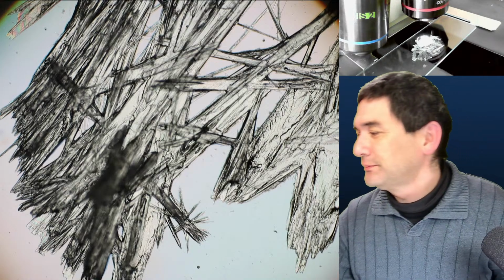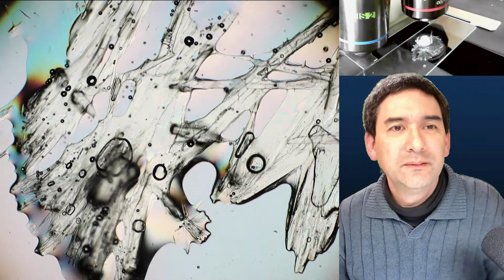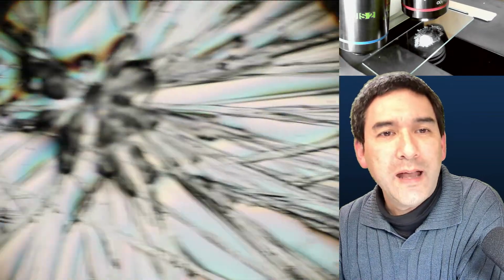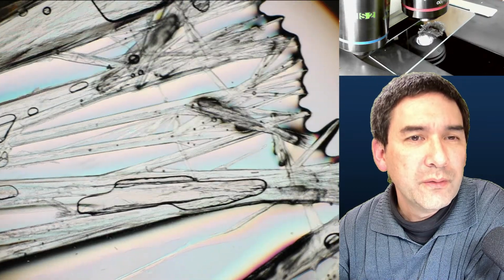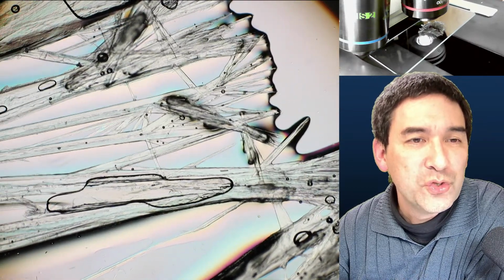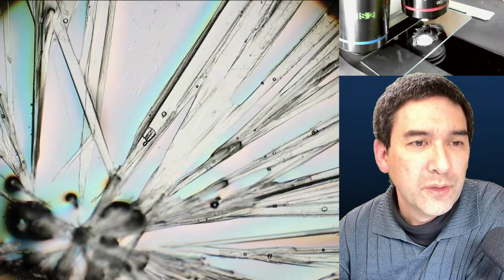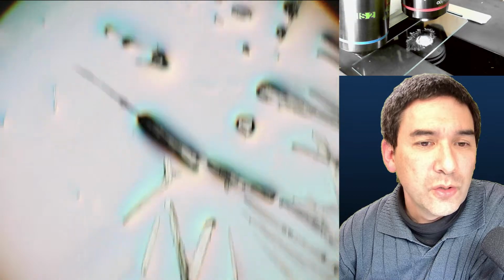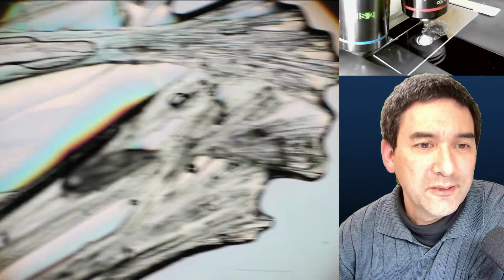And here again, let's add a little bit of water to see how this actually works. Yeah, all of the trapped air bubbles. Maybe, and by capillary action, it spreads all over the place. Then you will see that the further you go away, even though there's water there, the crystals do not seem to dissolve. The reason is that the solution is saturated already. Once it's saturated, it doesn't dissolve anymore. But further on the other side, where the liquid was still fresh, you see that the crystals have already dissolved. And here on the other side, the solution spread, became more saturated, and the crystals are still intact here.